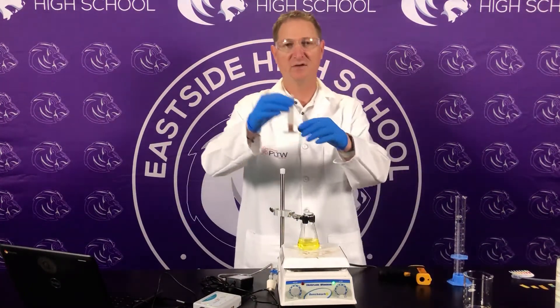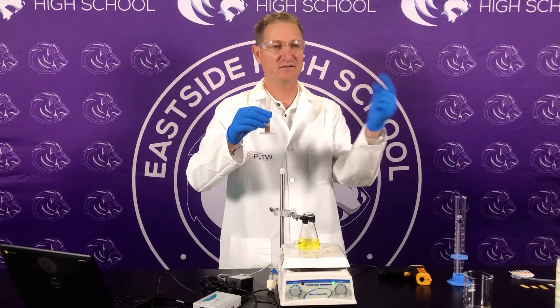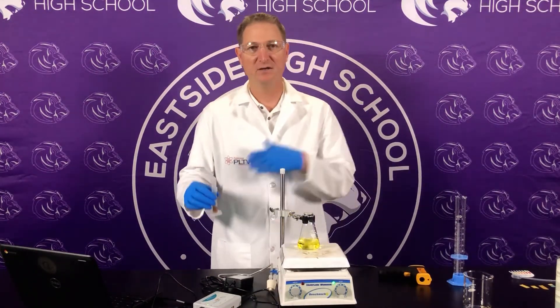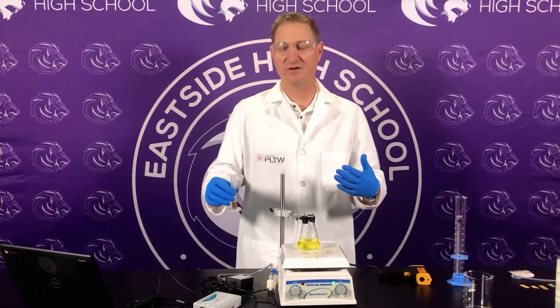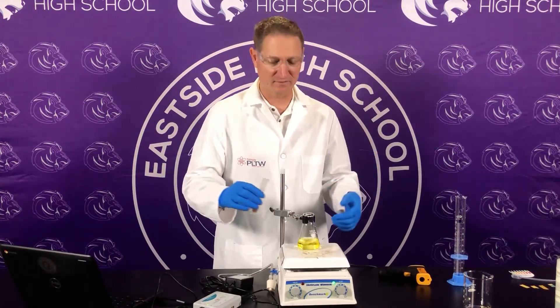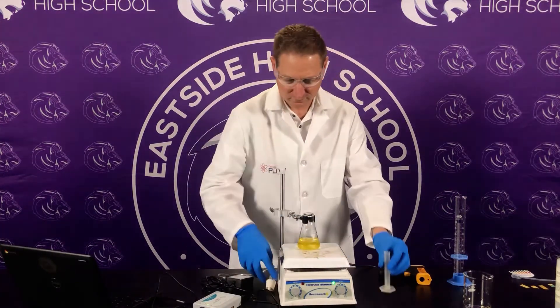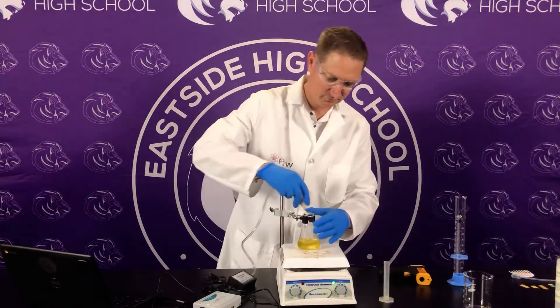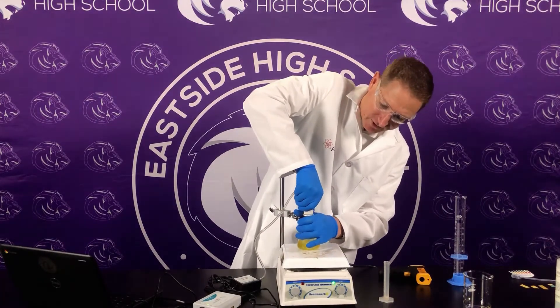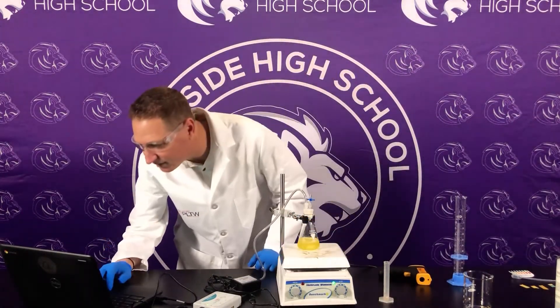Everything is set up. 200 seconds on Graphical Analysis. 2 mls of the catalase — the original catalase, the same one used in every other experiment. I'm going to put this in, put the top on, make sure we collect all the pressure, press collect, and go for 200 seconds. Making sure the pressure is good before we get it going.